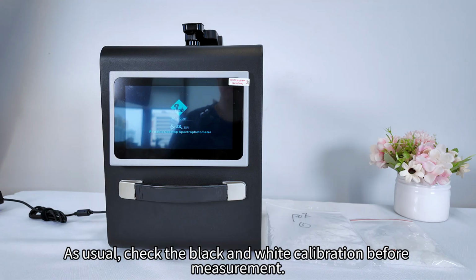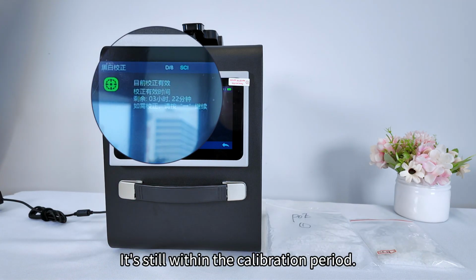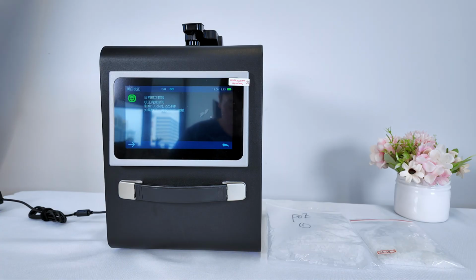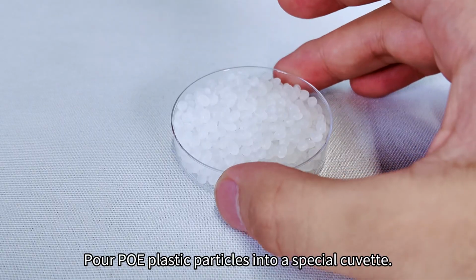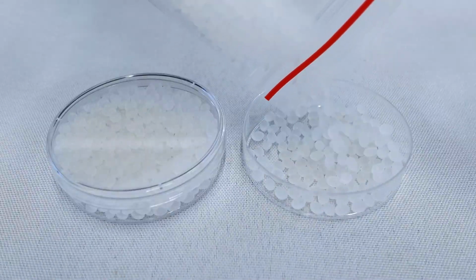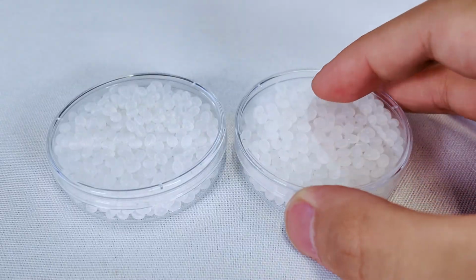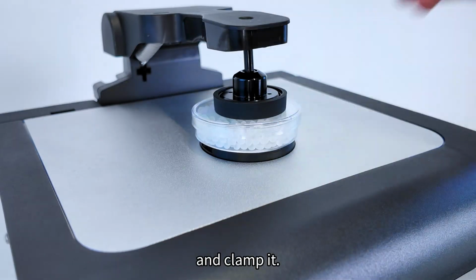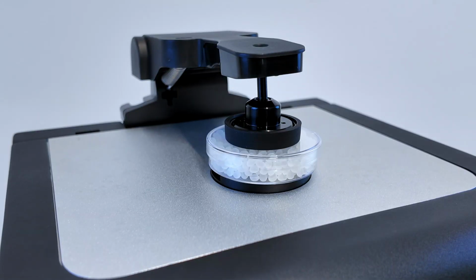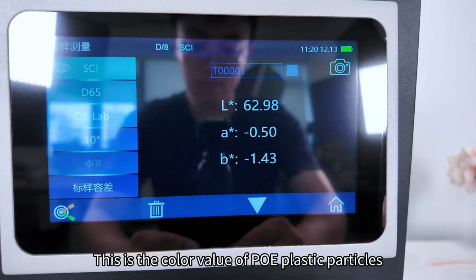As usual, check the black and white calibration before measurement. It's still within the calibration period. Pour POE plastic particles into a special cuvette. Place the POE plastic particle standard sample at the port and clamp it. Press the measurement button. This is the color value of POE plastic particles.